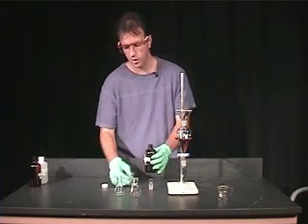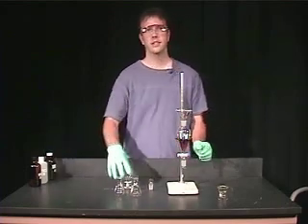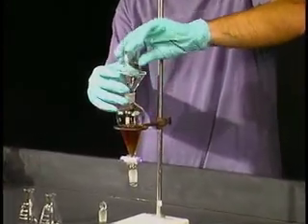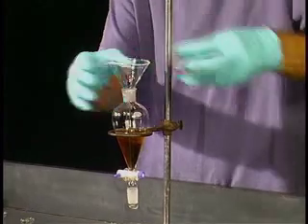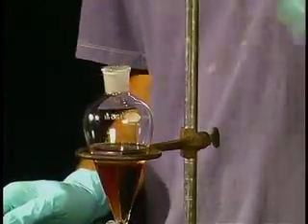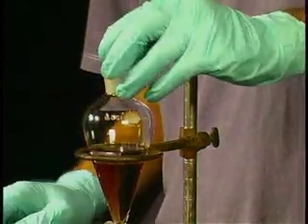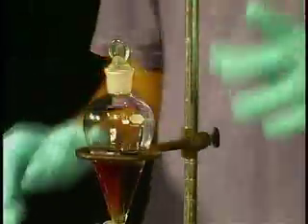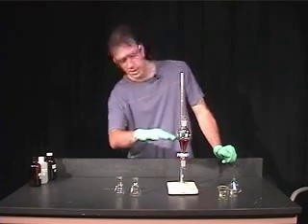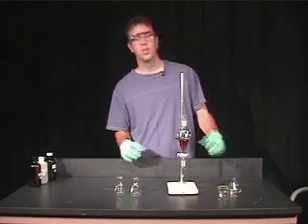I'm not measuring out the volume here — I'm just going to add a certain volume to show you the technique. Now, ethyl acetate and water are not miscible, meaning they don't dissolve in one another. The technique of extraction using a separatory funnel involves having the two solvents, and you should see roughly two layers. But if we just let it sit, there's not much contact between the two layers, so we have to mix them.